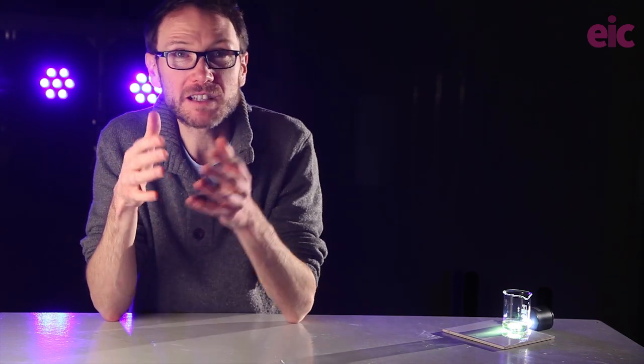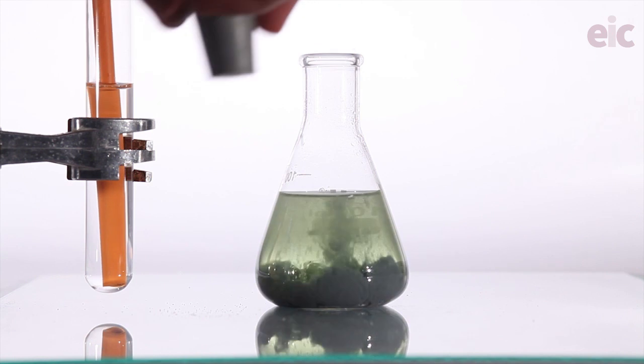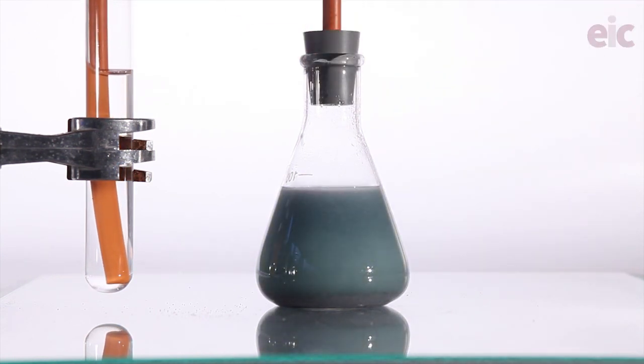But that's fine. I left it running in the background on a little plinth while we smashed through a load of practice E-cell and spontaneity predictions. There are so many different ways of doing this reaction, and almost none of them actually tell you how long it might realistically take. There are going to be some school-specific things as well that could make your life more difficult. Getting the reaction to run fast will often come at the cost of clarity of color as the solution gets filled up with tiny bubbles or fragments of powder.